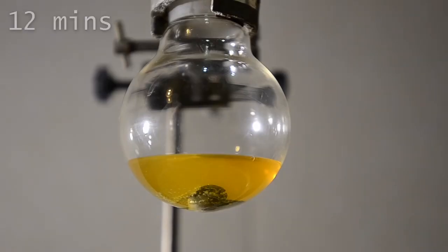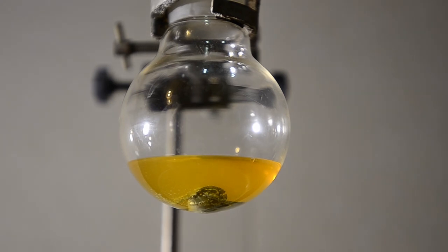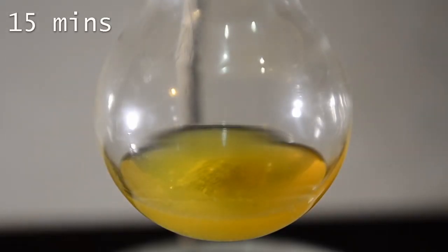We're fast forwarding and this is 12 minutes into the reaction, there's a slight turbidity and some bubbles. Now we're 15 minutes in, there's some white precipitate, a definite reaction occurring.